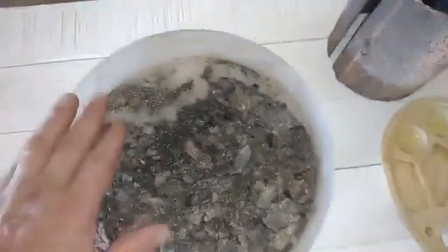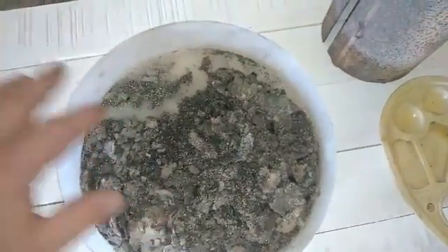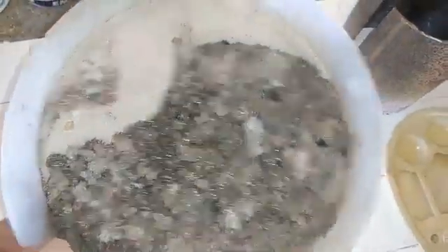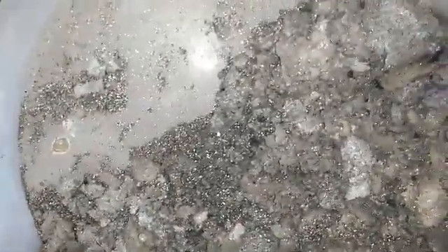So I tested that. My first test was just to check if it's aluminum foil — I put that in HCL, put it on heat and left it for 20 minutes, and nothing happened. These foils did not react with the HCL.